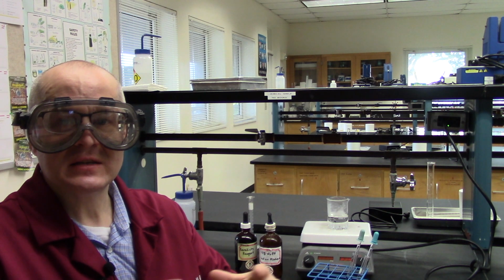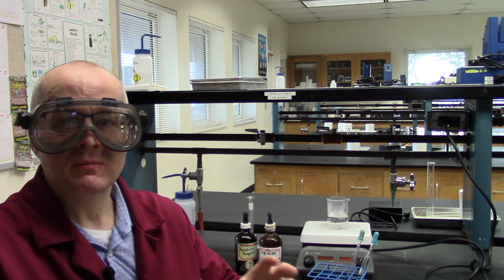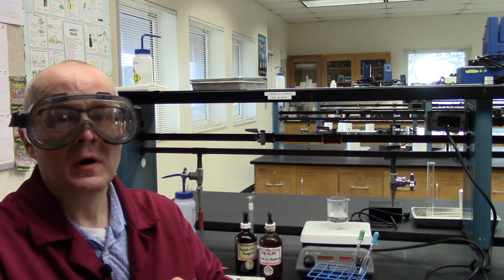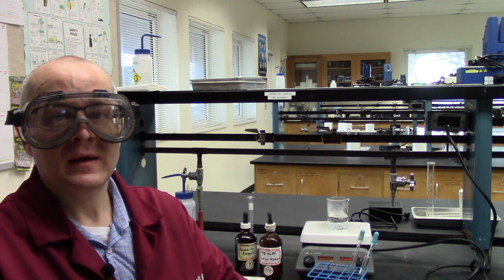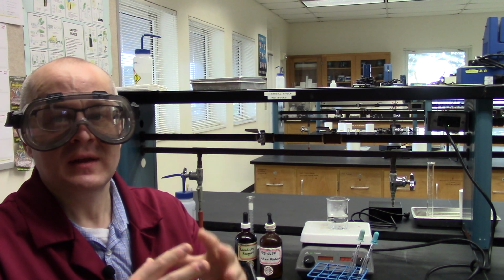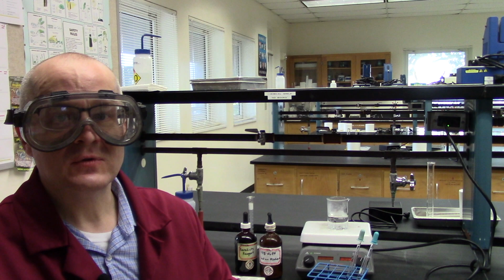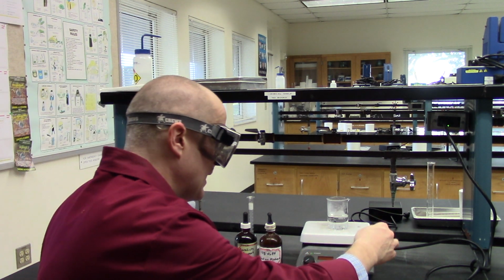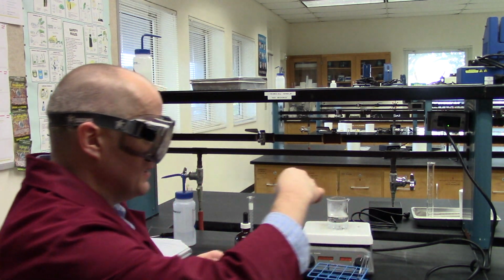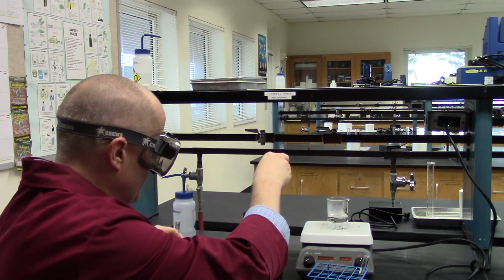So as we digest the starch with the acid and water at high heat, the starch falls apart to give us numerous glucose molecules. And as we saw with the Benedict's test before, glucose will turn red in the presence of Benedict's solution. So now we're going to test our starch digestion, the acid and starch, to see if there's glucose there. So let's do that experiment right now. I'm going to add a milliliter of Benedict's reagent to each one. So here's my test tube that's labeled acid. I'm going to add about a milliliter of Benedict's reagent to it.